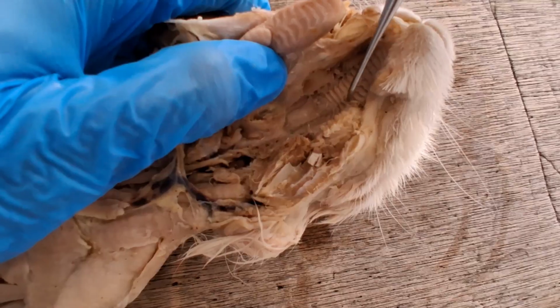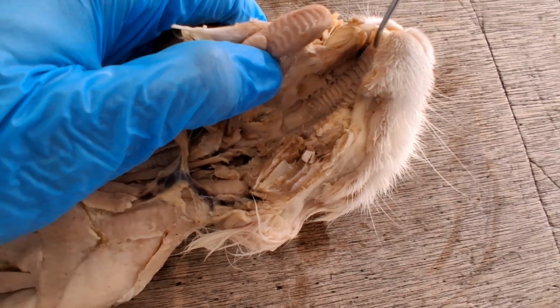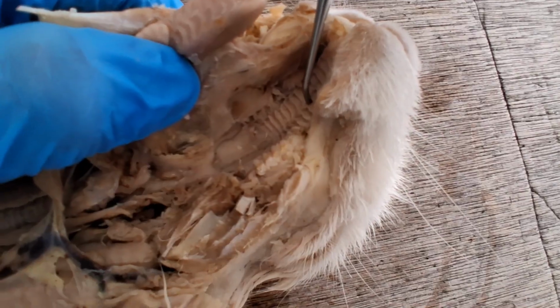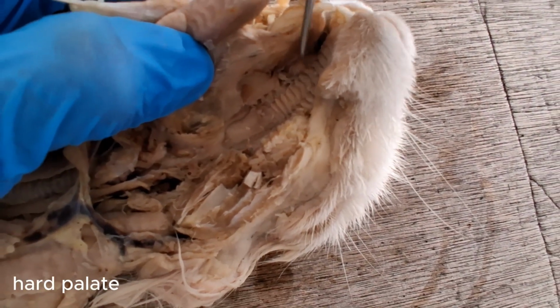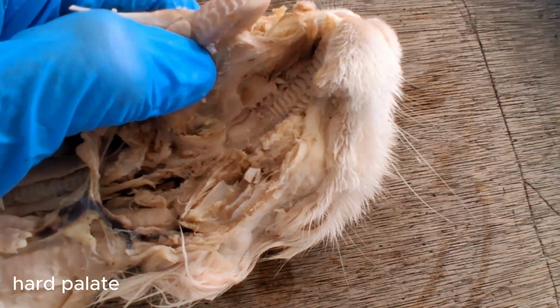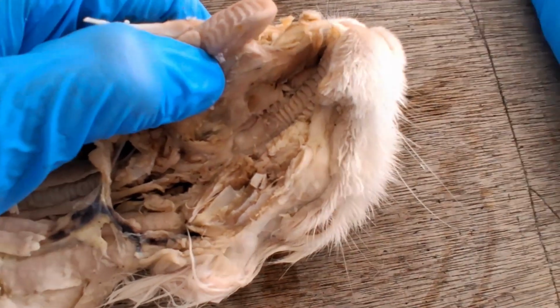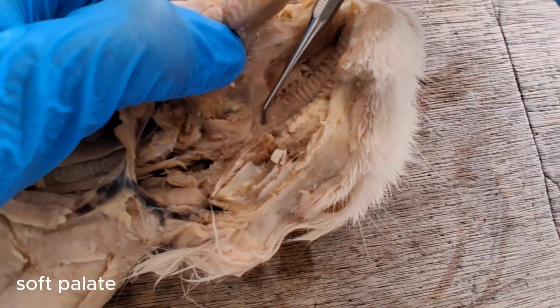So the roof of the mouth is covered by the palate, specifically a secondary palate. This one with the transverse ridges is the hard palate, so if you touch it, it's supported by bone. And then posterior to it would be a softer portion of the palate, the soft palate.